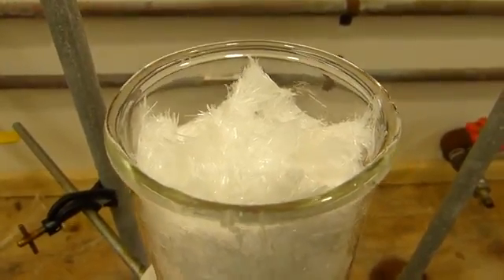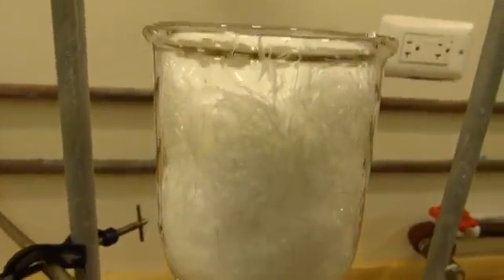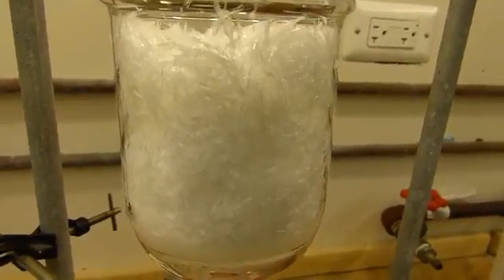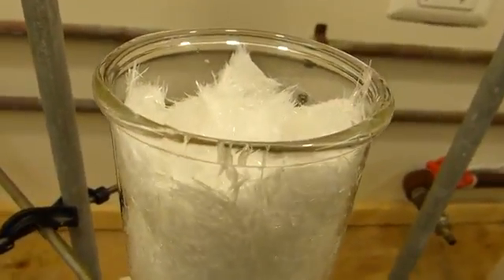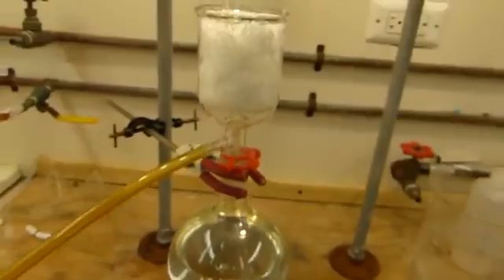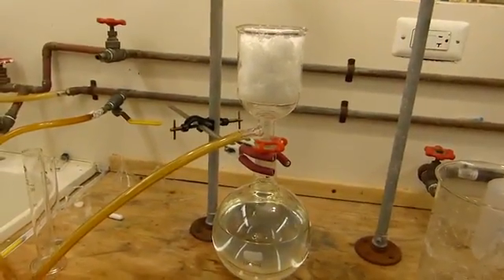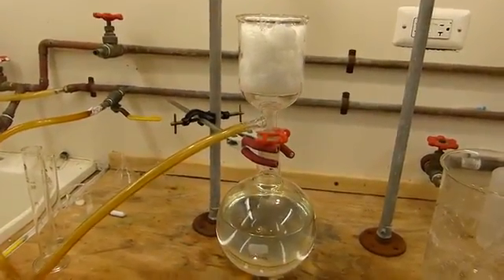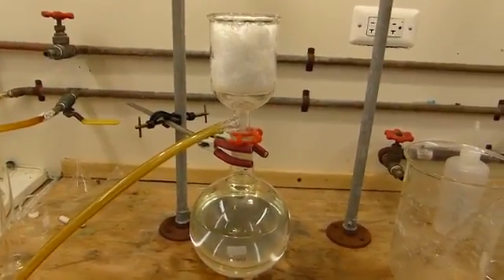There we have some nice crystals of pure benzoic acid. Chemistry sure does look cool sometimes. Anyway, I'm gonna turn the vacuum on and I'll let this suck the water out of it for a little longer, maybe five more minutes, and then transfer it to the standard drying tray.